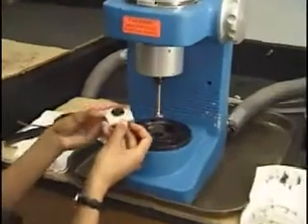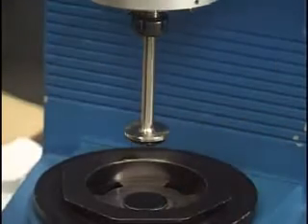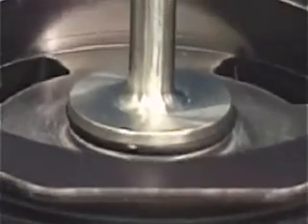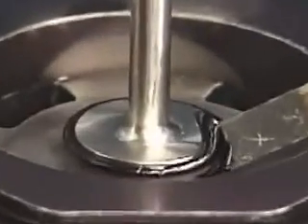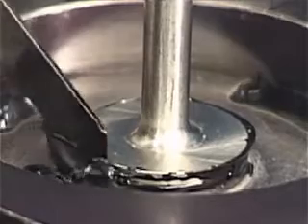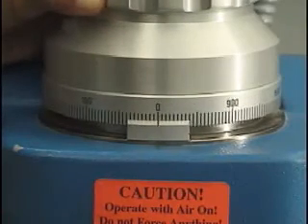Sample Testing. Detach the binder sample from the silicone mold by flexing the mold. Press the sample gently against the spindle. Do not touch the sample — oil from your fingers could introduce errors. Lower the spindle until the binder sample is sandwiched between the base plate and the spindle. Using a heated spatula, trim off the excess sample. Take care not to gouge the sides or pull material from between the plates. Then dial out the extra 50 microns.